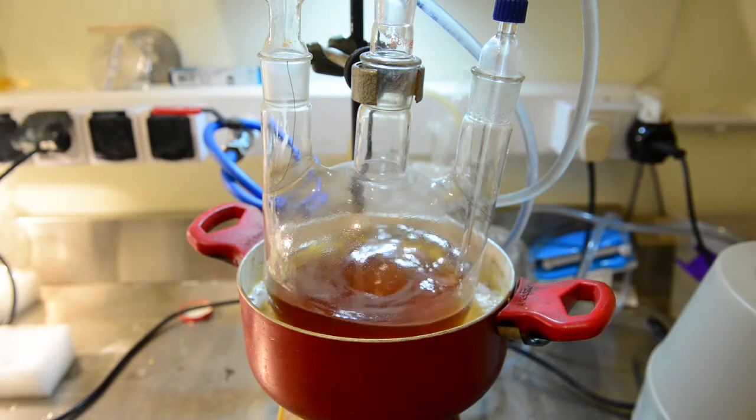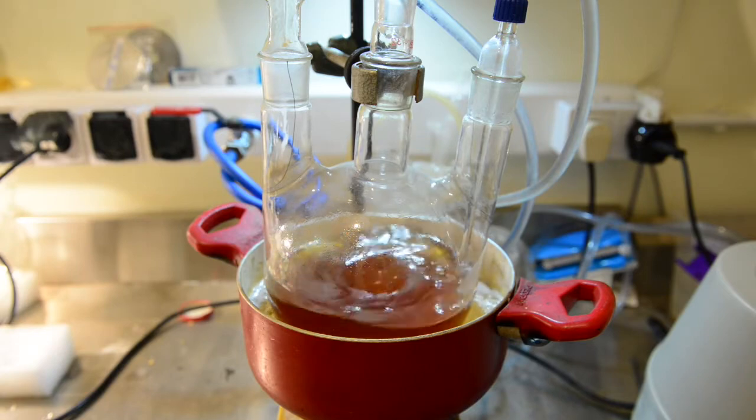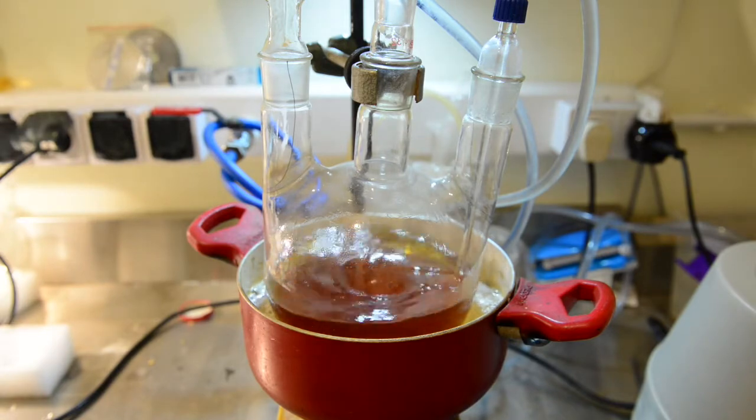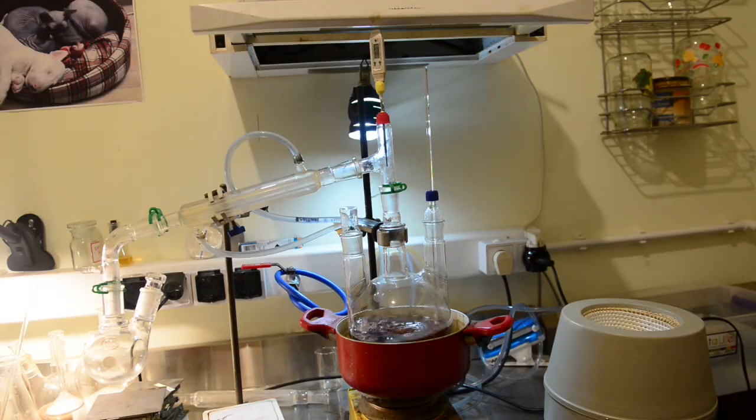One hour of reflux is enough. During the reflux, the liquid has darkened to the brown yellowish color. We let everything cool down till the next day and had started the distillation process.